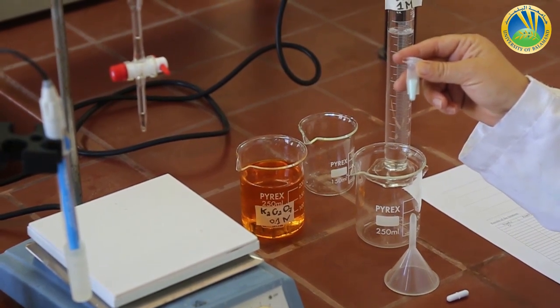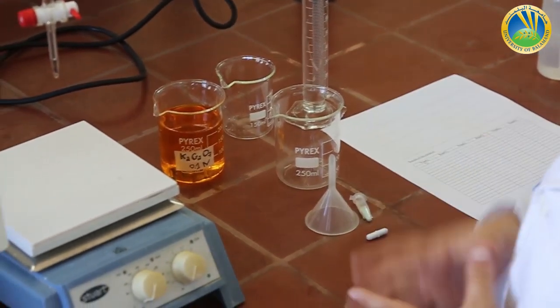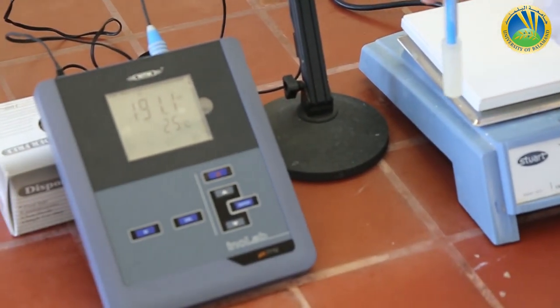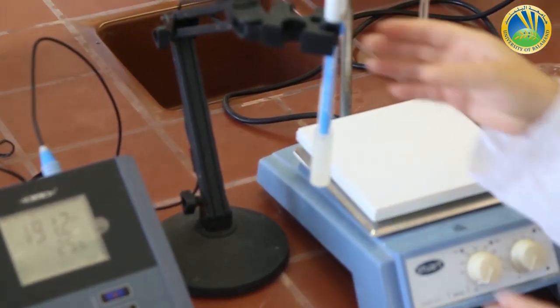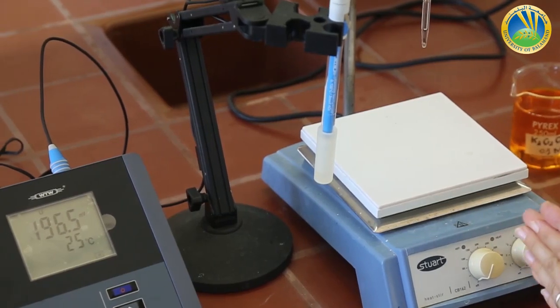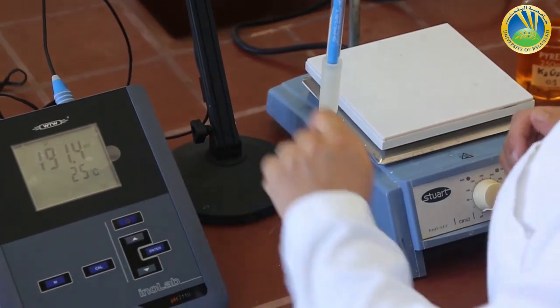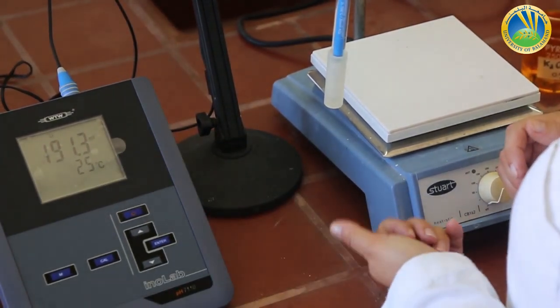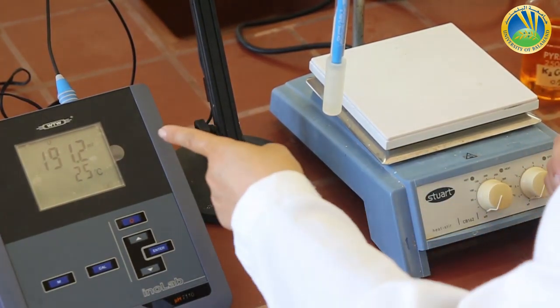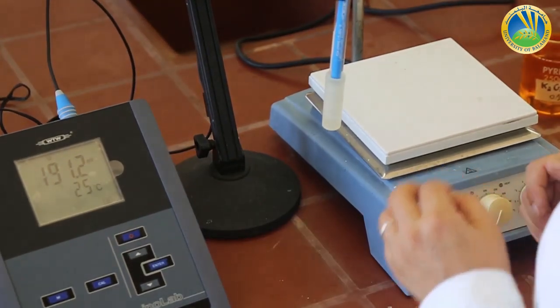You need the FeSO4·7H2O for your later calculation of the molecular weight. We are going to use a potentiometer with a redox electrode. It is internally different than the electrode used in the acid-base potentiometric titration. The potentiometer is giving us a potential value today, instead of the pH value it gave us in the last experiment.